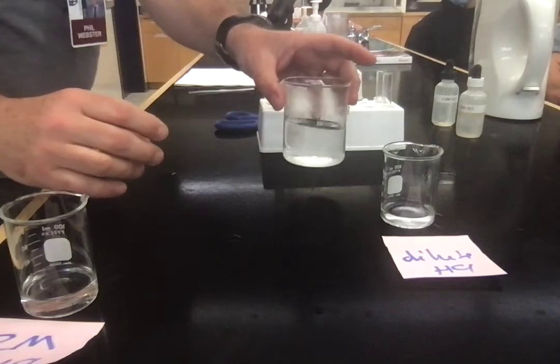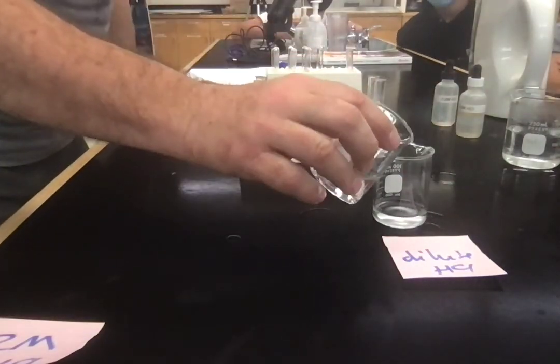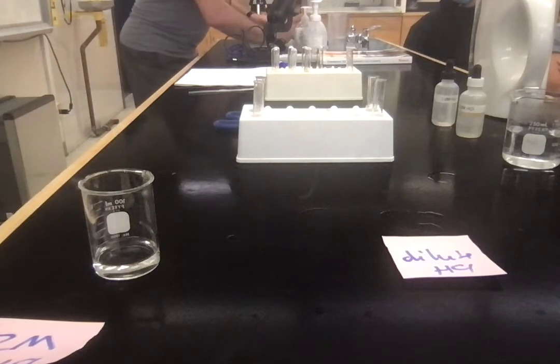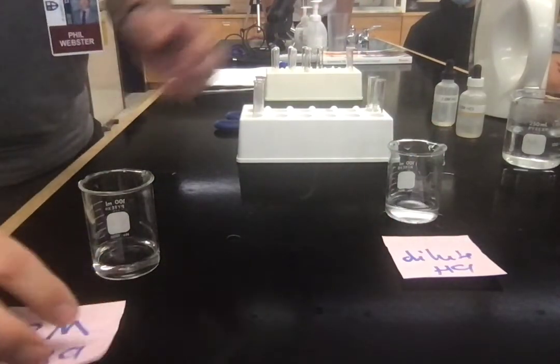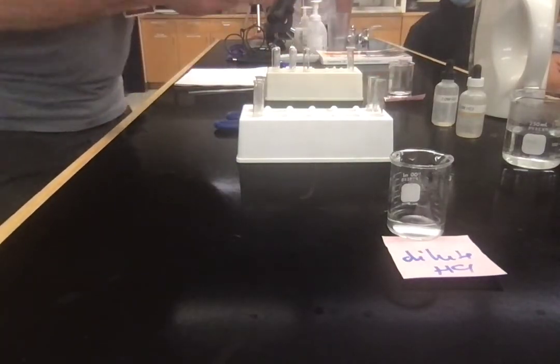All right. The third one is nice and easy because I can use my dilute. I might have to make a little bit more of it. Let's just make a little bit more of it. There we go. The last one. Now, this last one, we've got our dilute HCl. We're not using the 2. I'm going to use 2 of these.